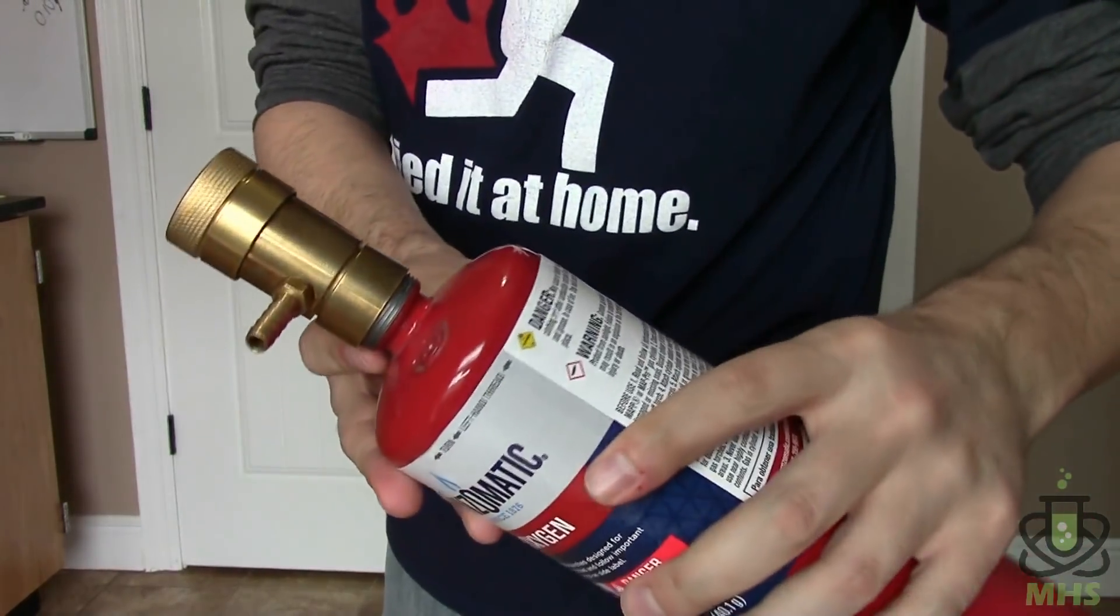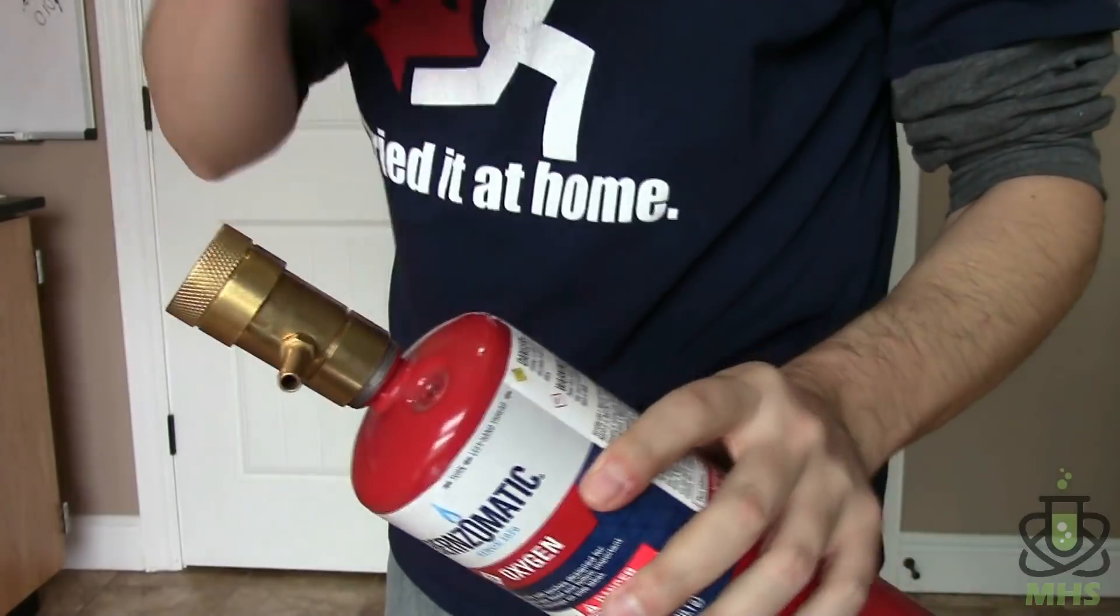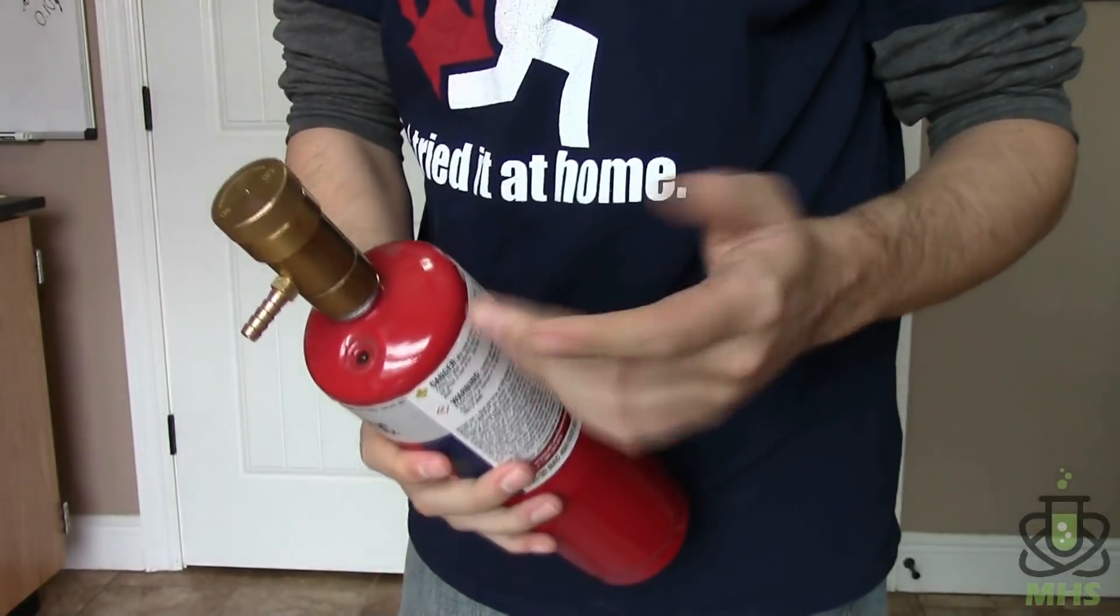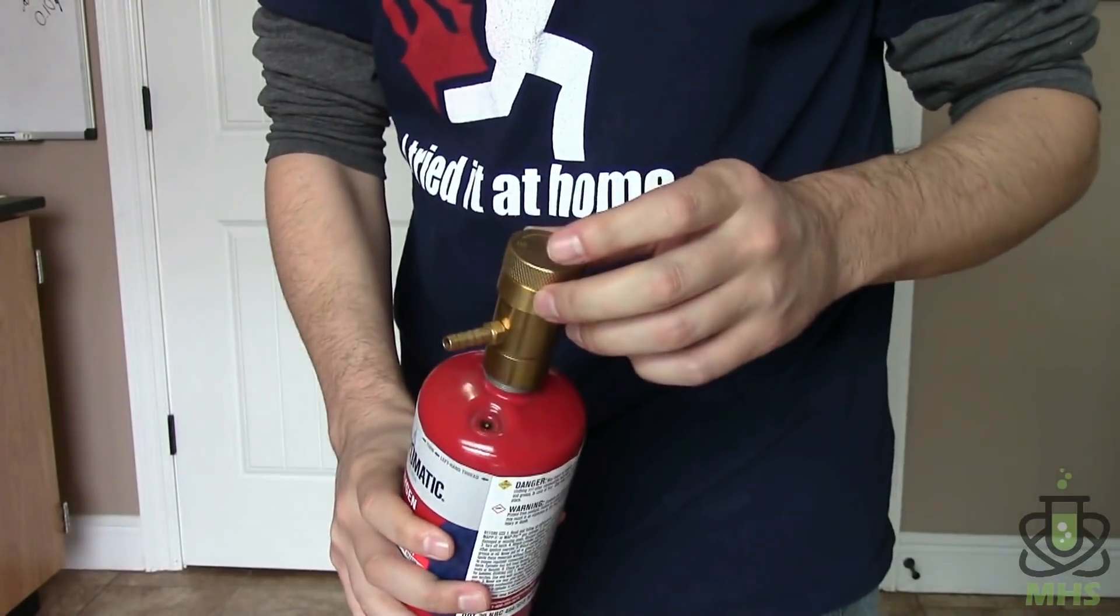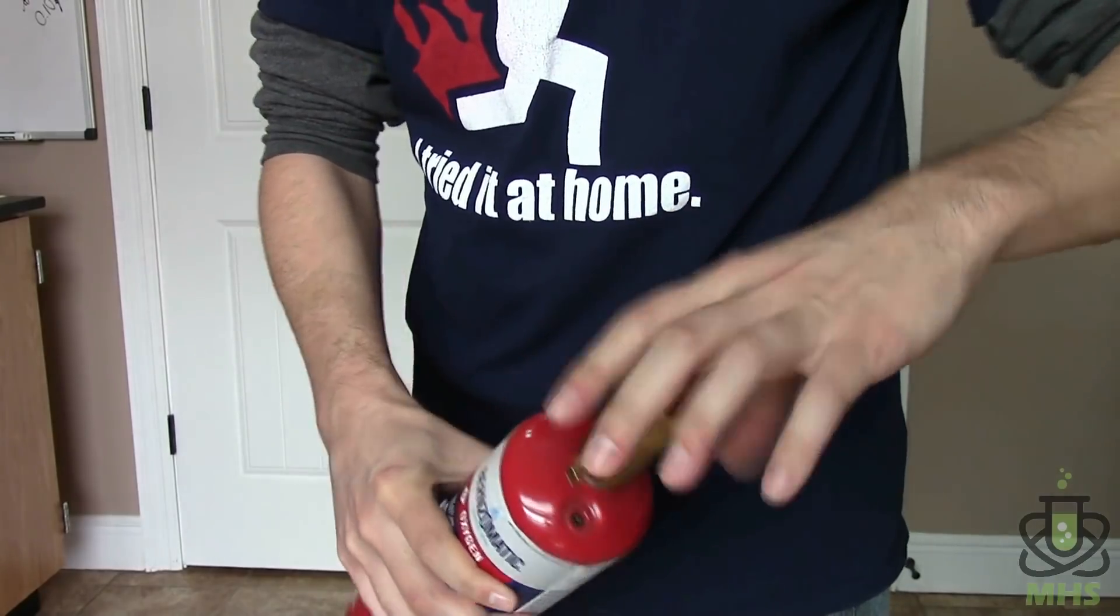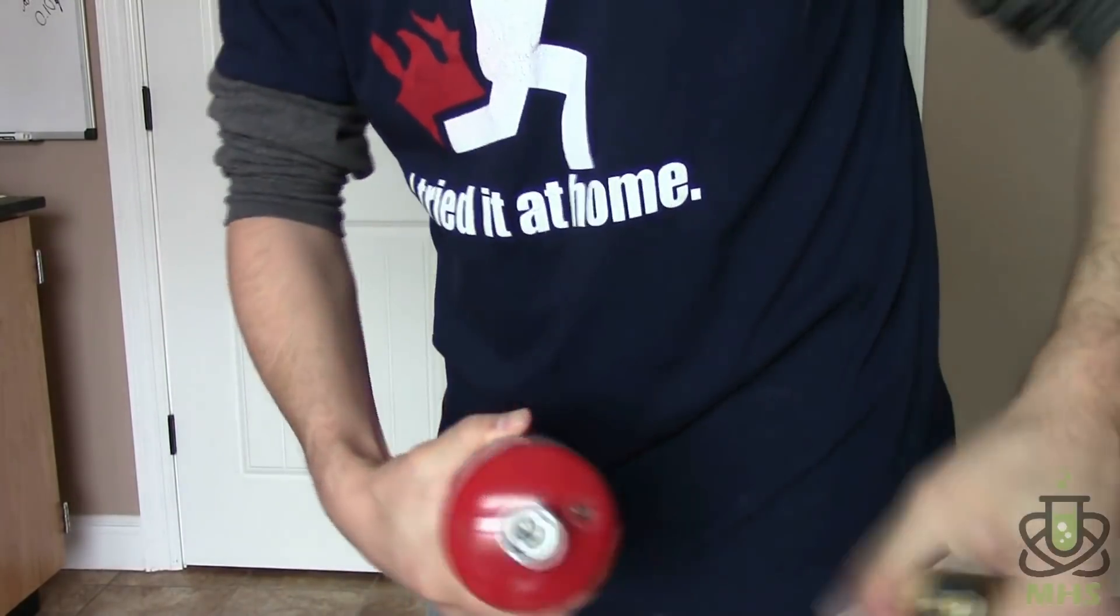It doesn't fit on there quite perfectly so don't screw it on too tight or you might strip the threads but it seals well enough and seems to work okay. And then when you want to take it off you can leave it closed and it just pops right off.